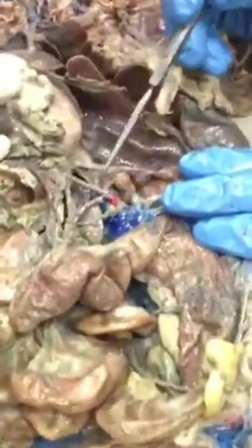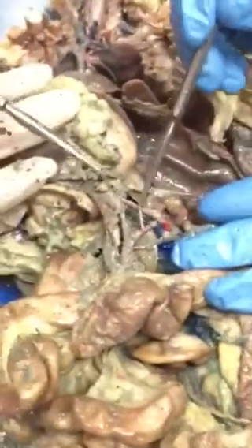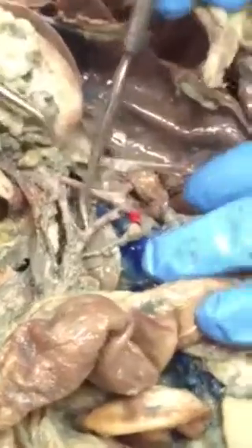Can we really quick just go back down here? Yes. Thank you so much. Okay, so this again was the celiac, and then the next major branch off, which we've broken here, is the superior mesenteric, and you can actually see these are all small intestines. So look, this is going towards the small intestine.